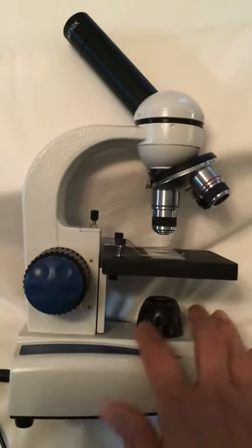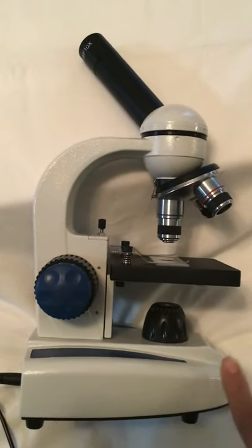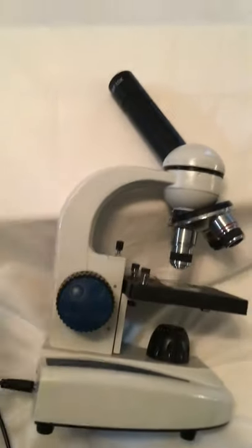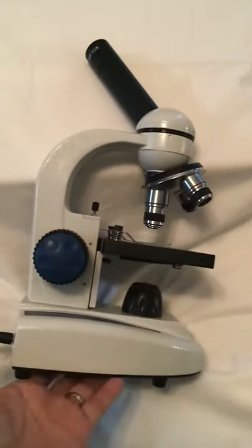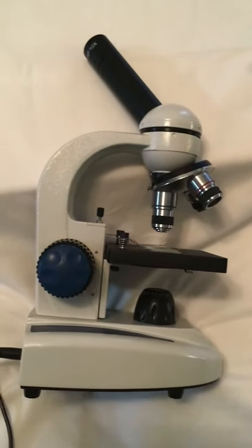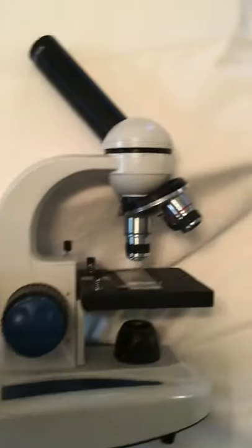Again, here's the lamp—that's your light source—and this right here is the base. Whenever you carry a microscope, proper carrying techniques involve one hand on the arm and one hand below the base. That would keep the microscope from accidentally slipping or sliding out of your hands as you are transporting it.